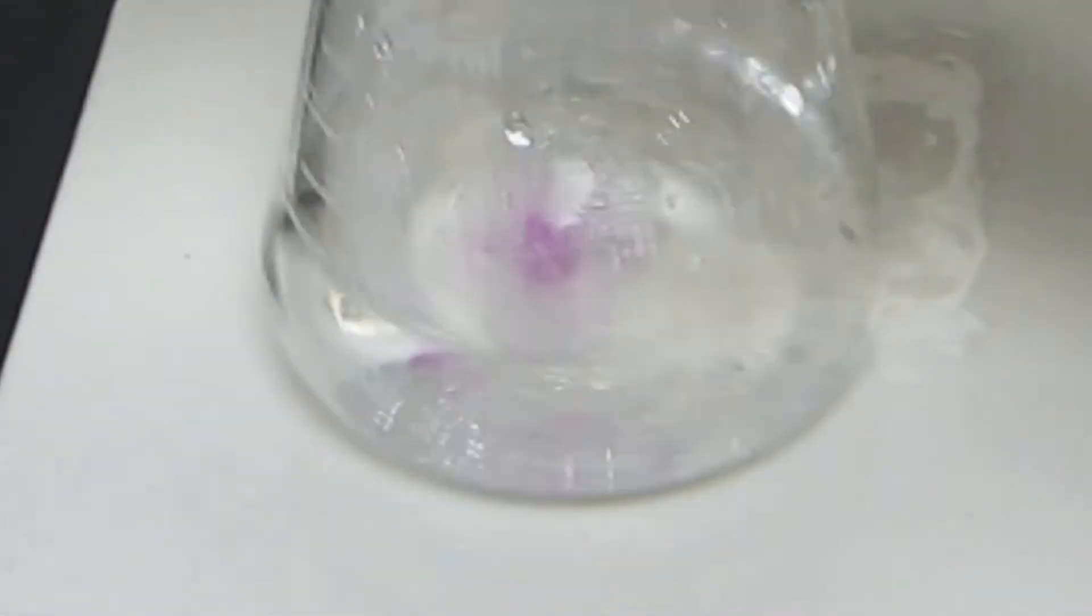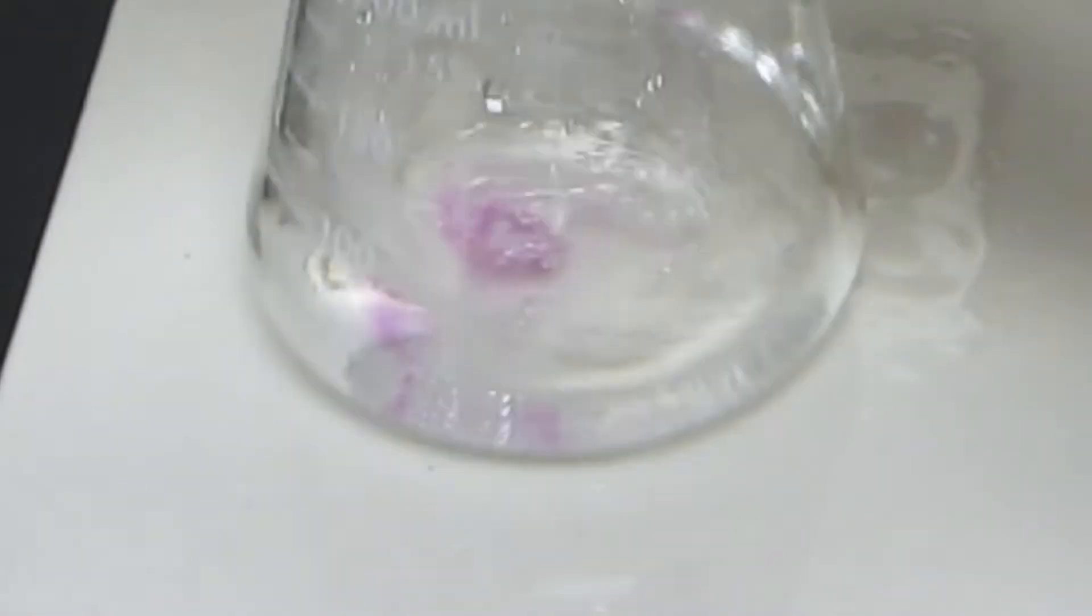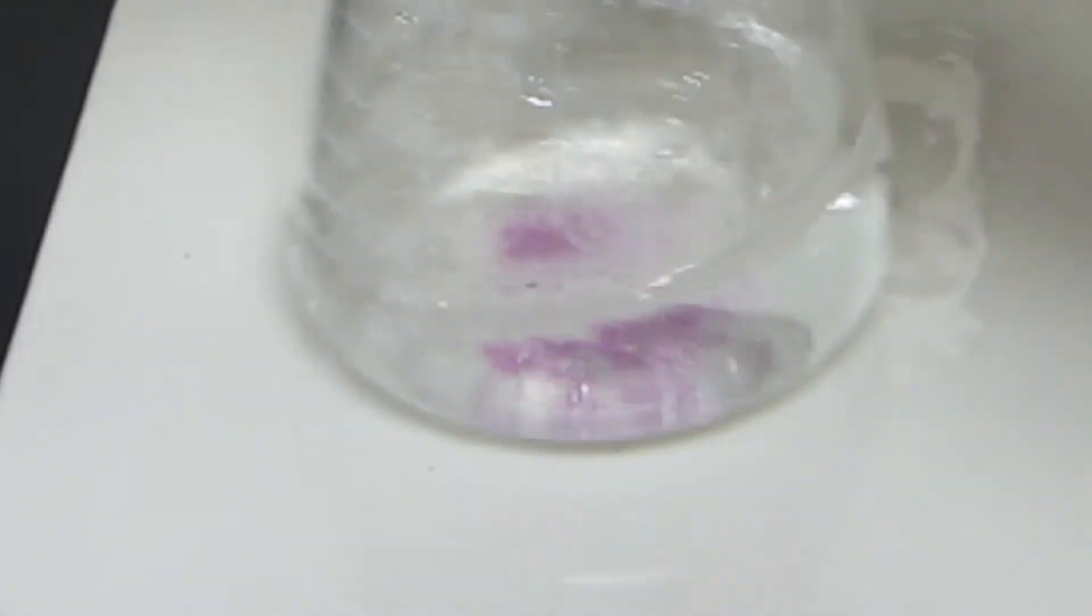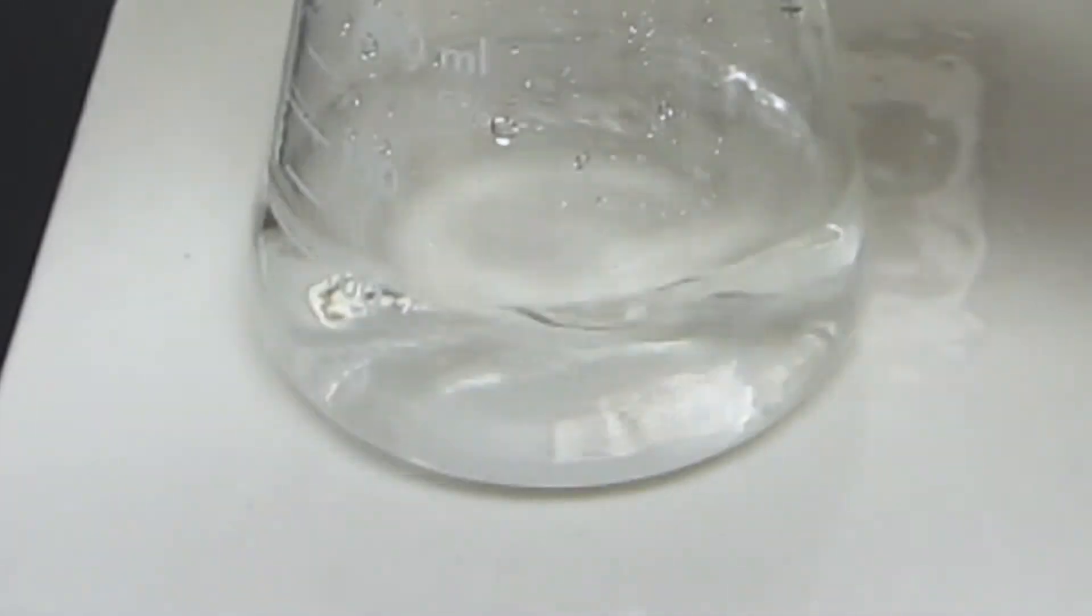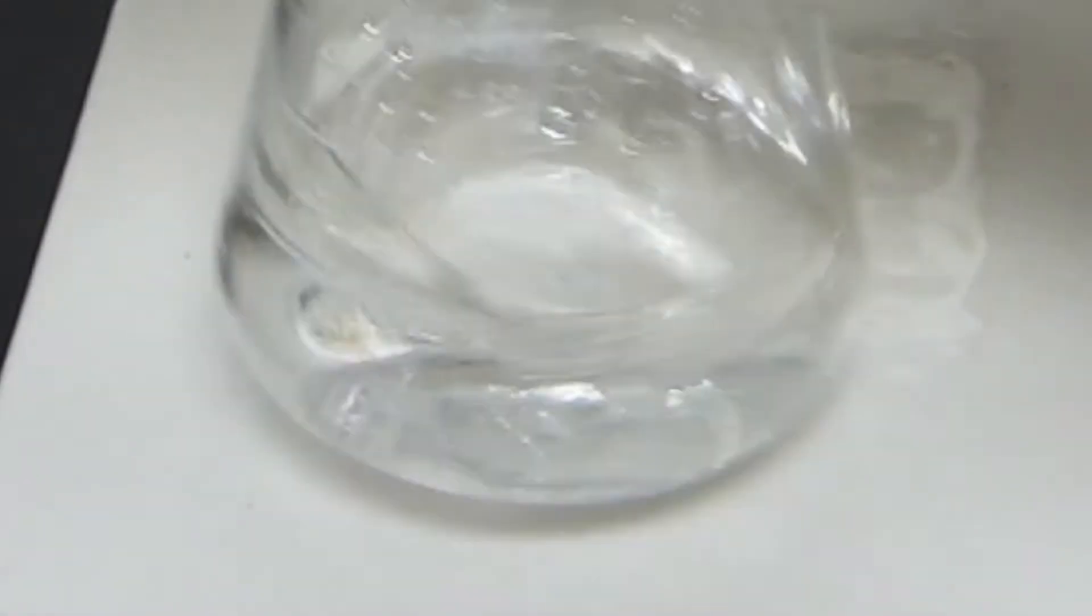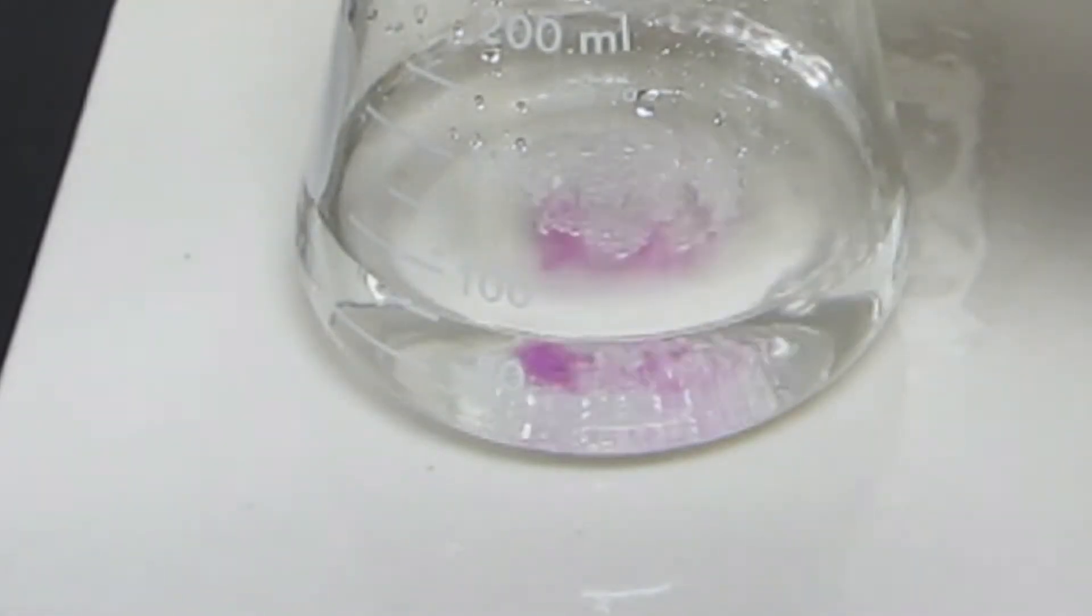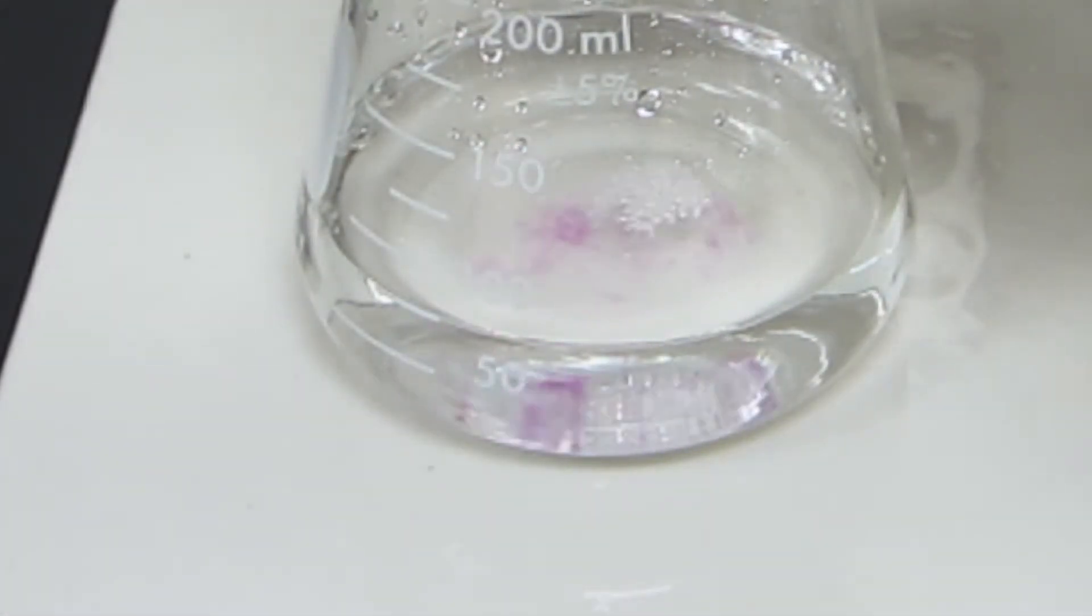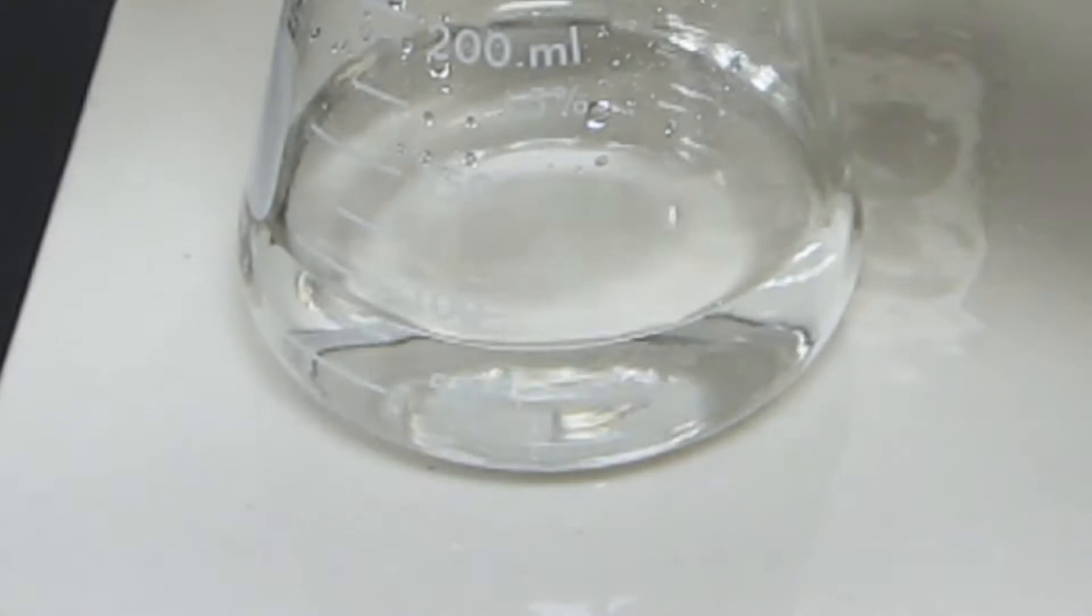Sometimes these things are very quick, sometimes it takes a while. From past experiences this may take maybe 40 milliliters. You can see that as I mix this thing around, that purple color disappears. I'll just add a little bit without mixing. So there's local neutralization occurring there. You can still see a little purple, and you want to swirl it around there.